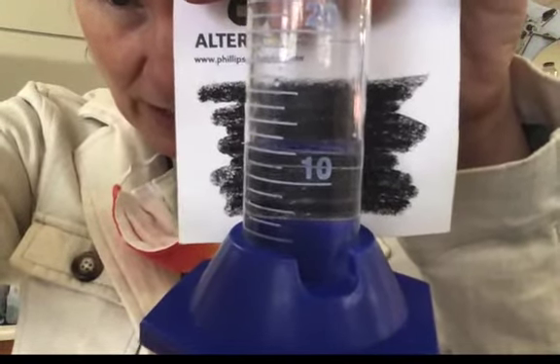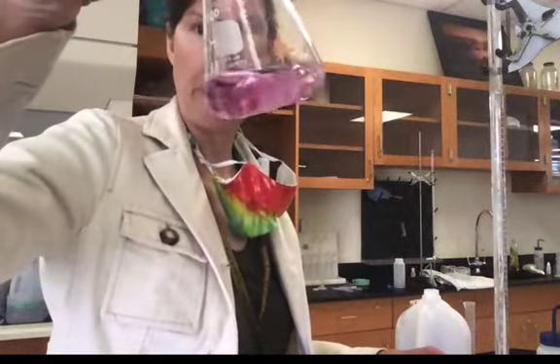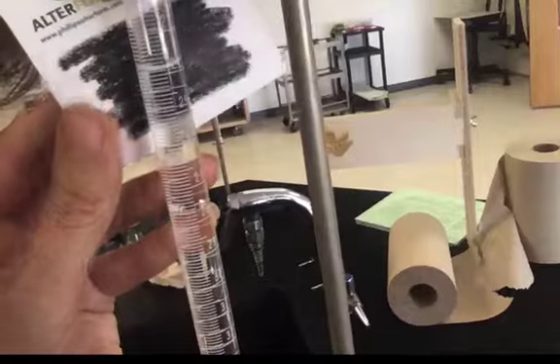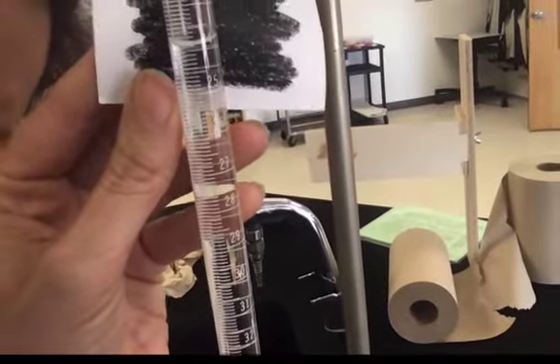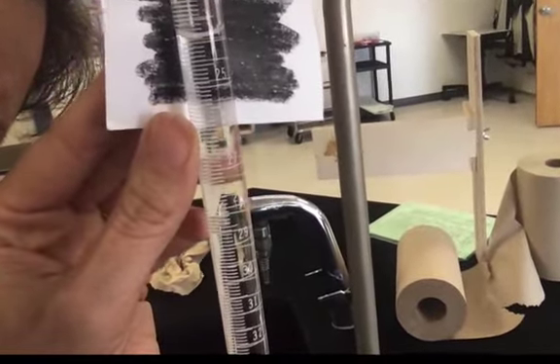Amount of acid for your second trial. Final color for the second trial. Final reading for your second trial — this will also be your initial reading for your third trial.